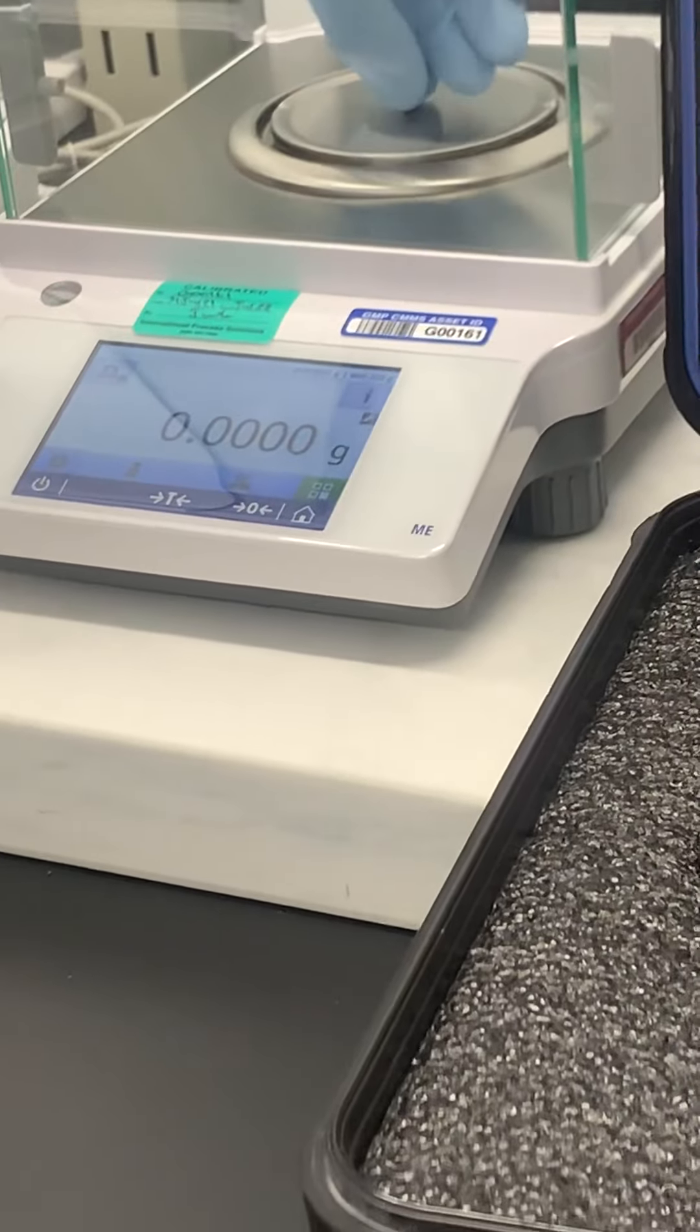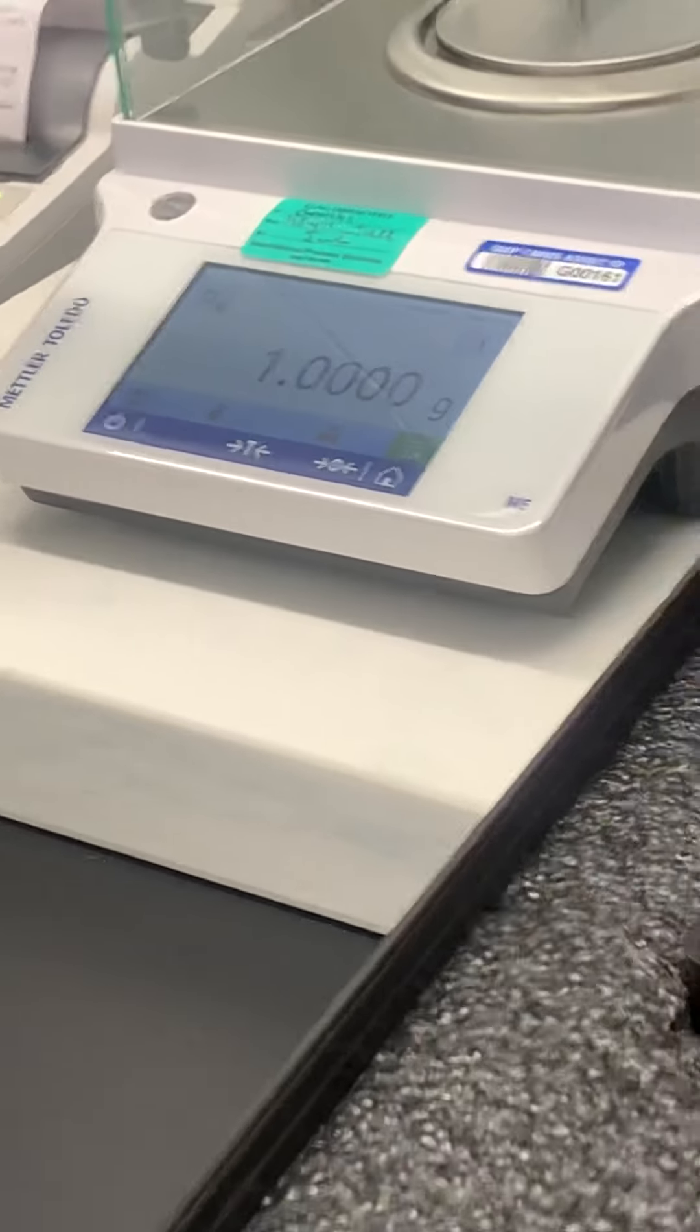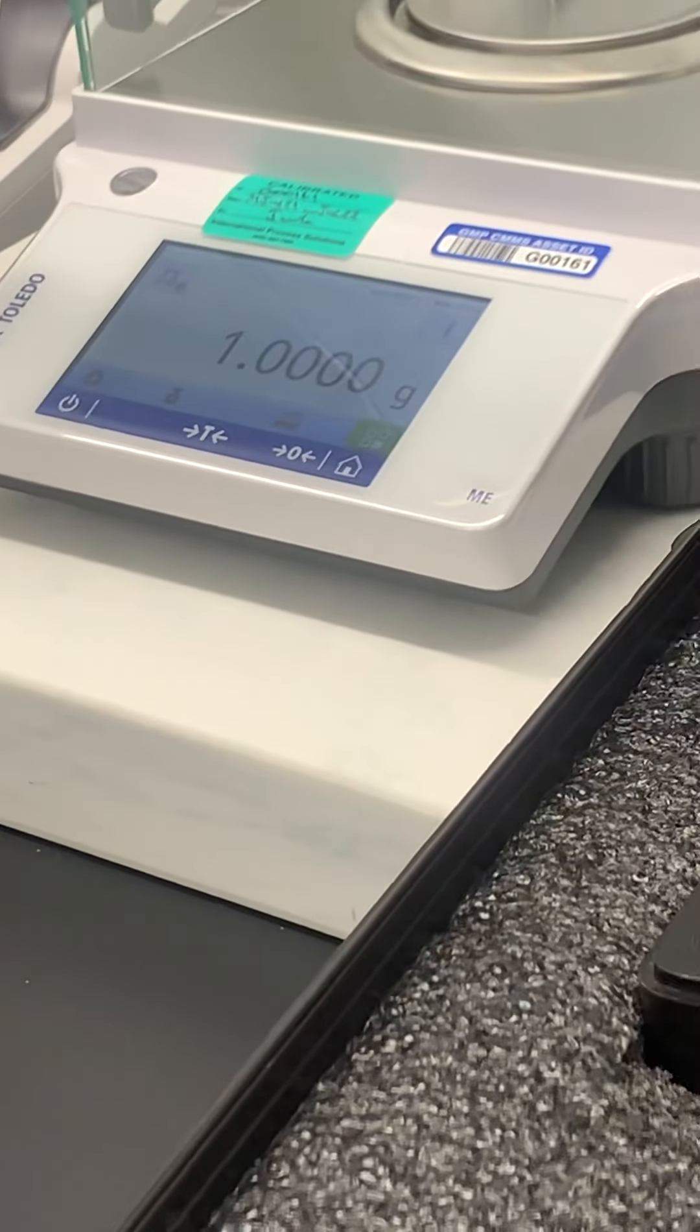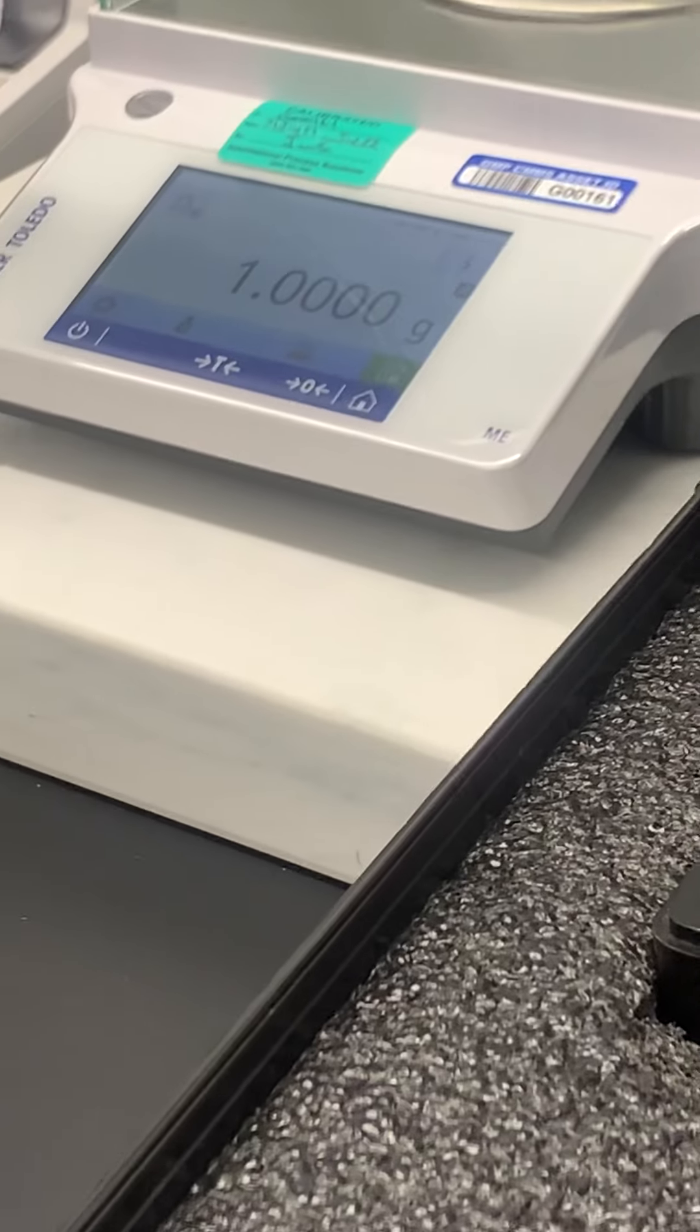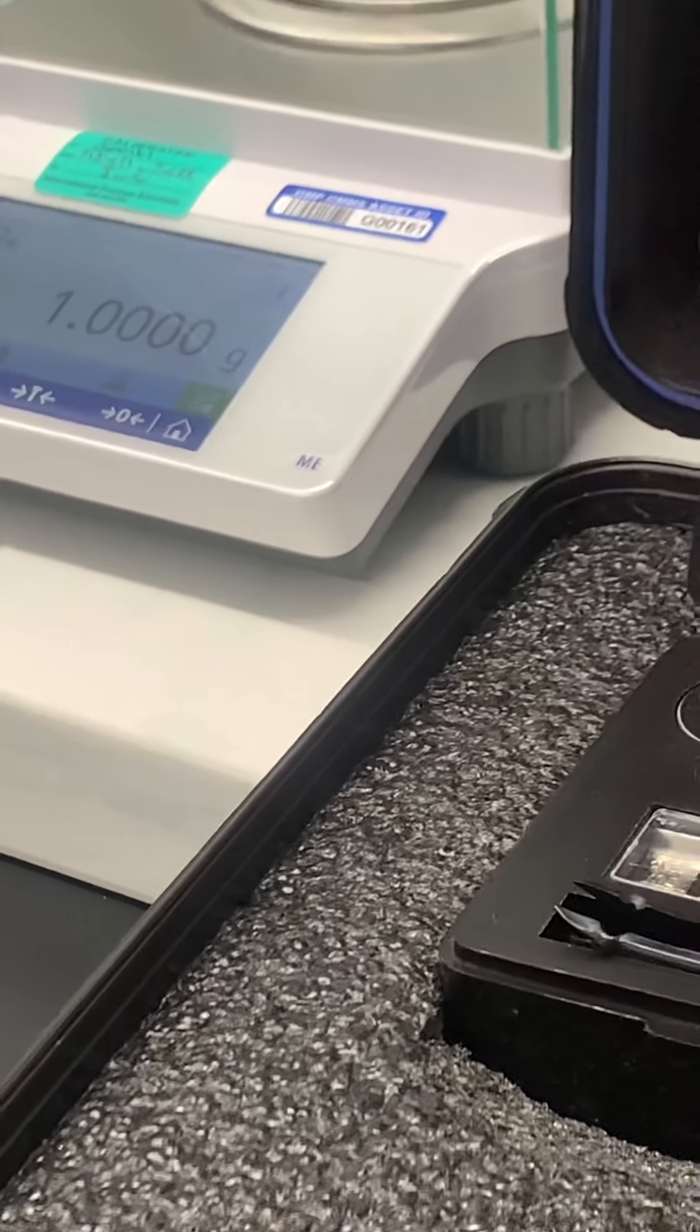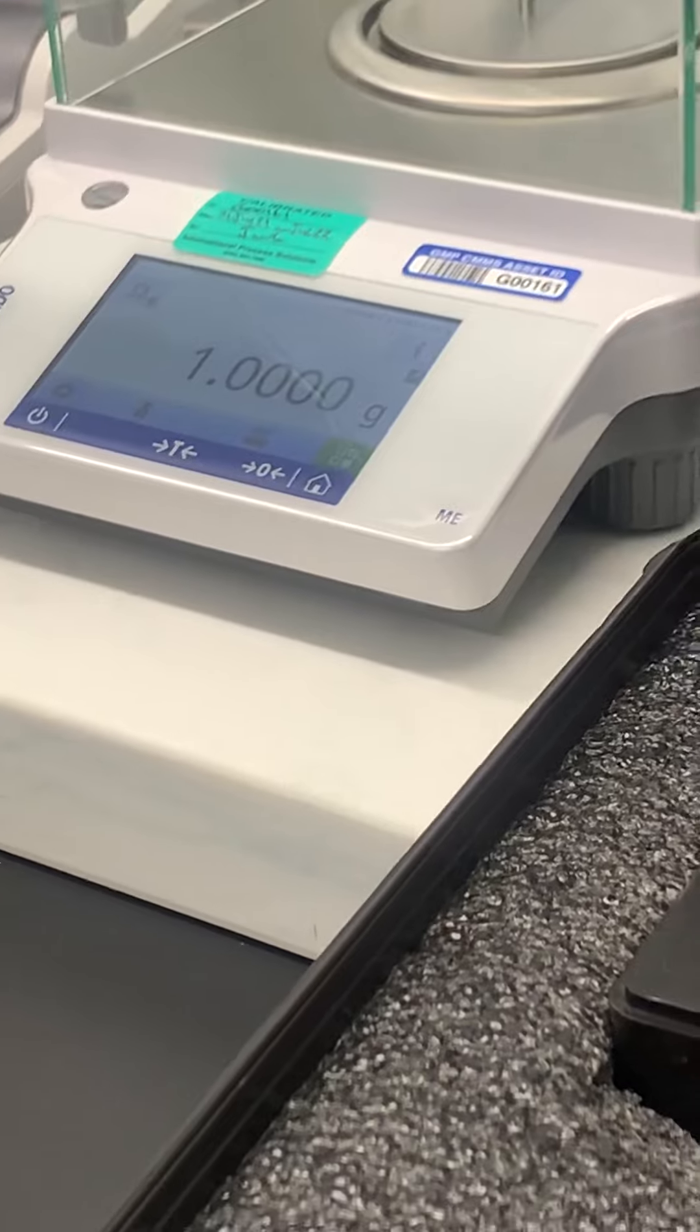Also depending on some of the weight stuff, this isn't really a good one to test, but sometimes you'll have to use a bunch of weights. Say it's like 15 kilograms and you have to use different sets - you want to try and stack them in the middle, just as close to the middle as possible.